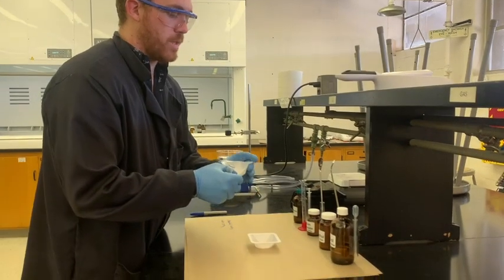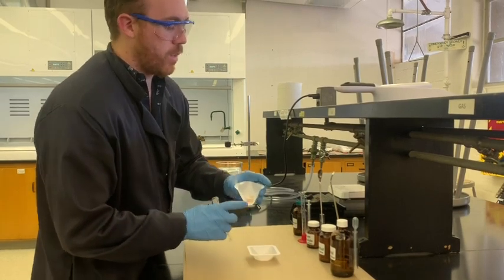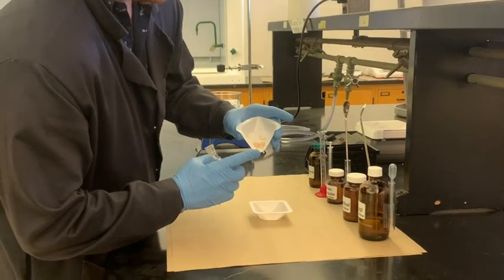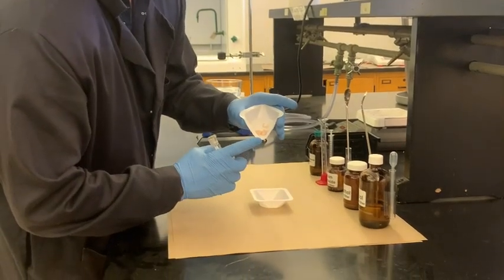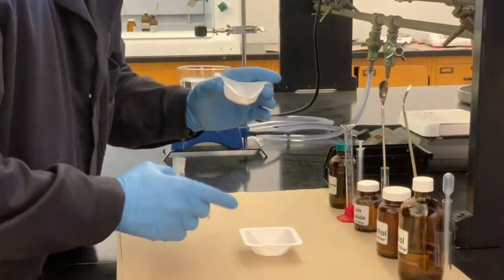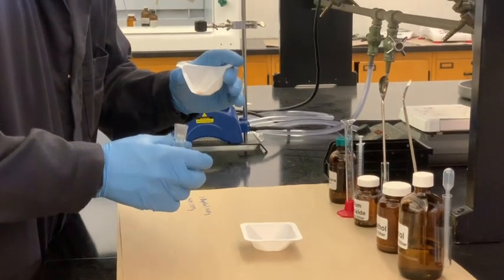Like I said, dry first. Always try to get as much of this as you can into the flask. If you want to take a look at it here, it's kind of flaky, sort of opaque, not clear or crystalline, a little bit more dull. That's a good way to know. So I have two weighboats here; I can either label them or just recognize the reagent inside. Sometimes they're a little too close and you definitely should label.